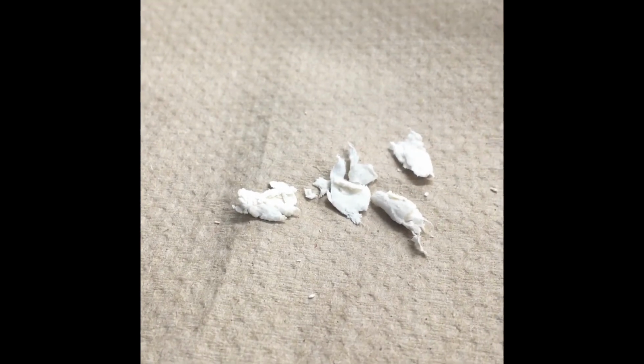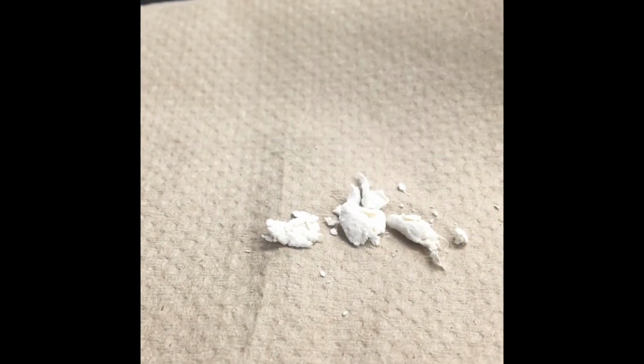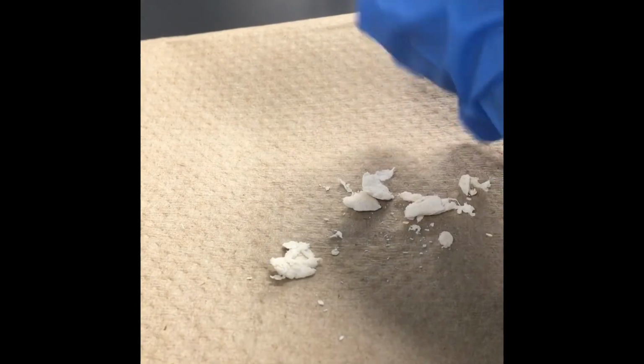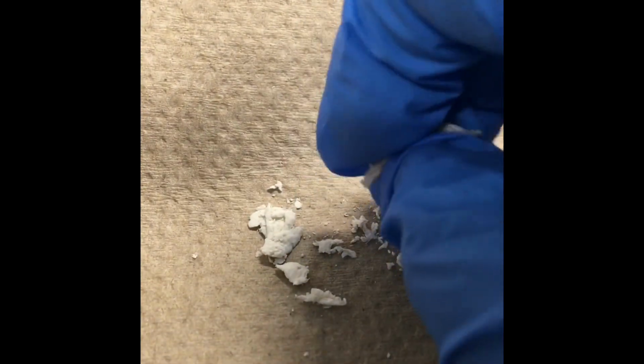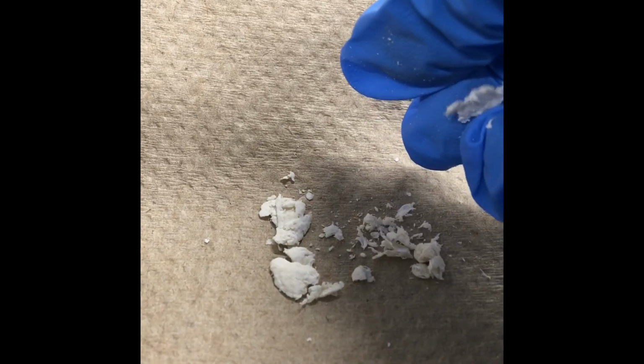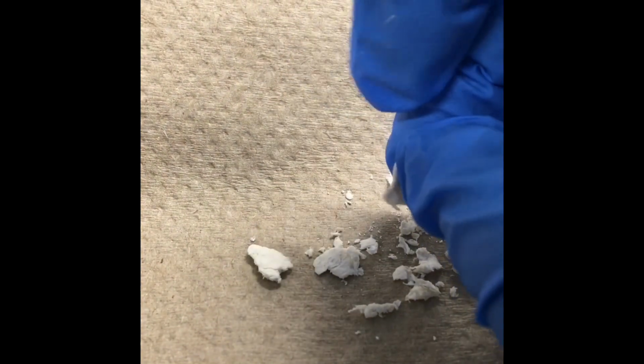Okay, so now here you can see that I have the nylon left, and I have it in bulk instead of in a rope. But as you can see, it's dried out. What I did is immerse it in water, and then make sure that it was clean. You can see that the nylon is pretty strong, but we can break it into smaller fibers. And again, as I said, if we had it in rope, then those ropes can intertwine and make it very strong. In this situation, you can even see a little bit where there are some little ropes that are forming. So this is the experiment of nylon, and I hope that you guys liked it.